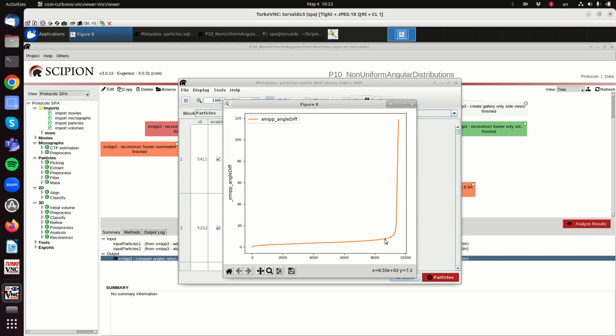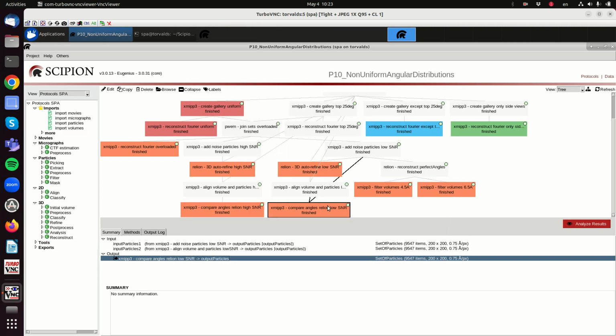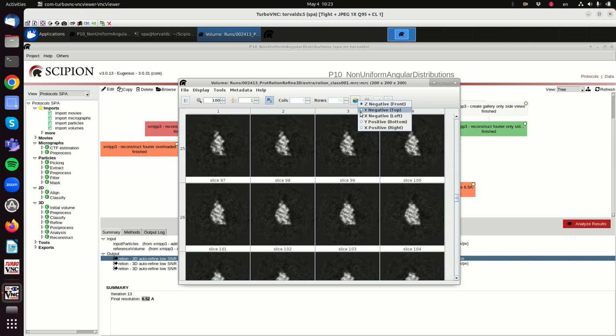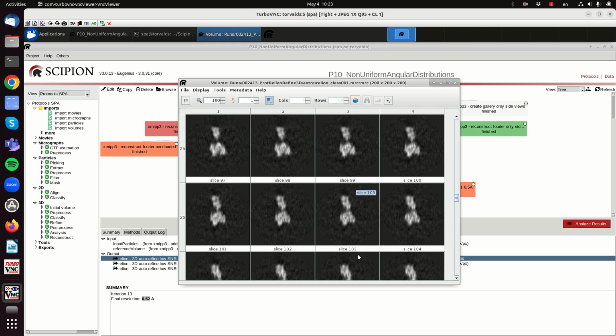It is 7-8 angstroms, which is enough to blur it quite a lot. But what we will see is that this blurring is not uniform. So the blurring occurs mostly at the top views. When we look at the structure, the claimed resolution is 6.5, and in principle it seems to be correct, but when we make slices in the other direction, we see something strange here. It seems that in this direction, that is the direction of the top views, we don't have enough resolution.